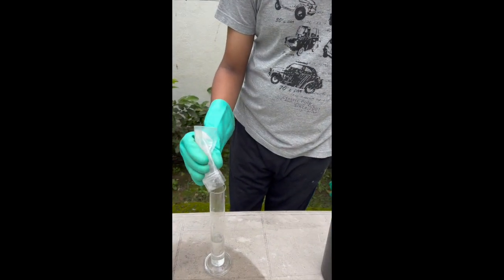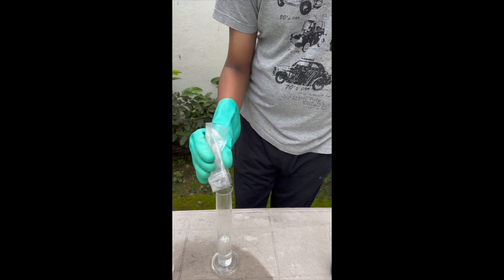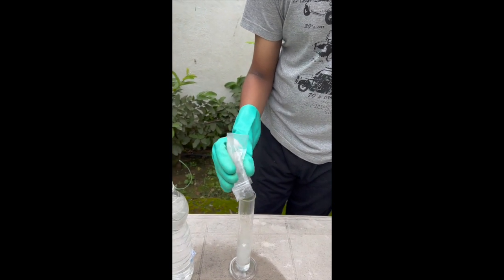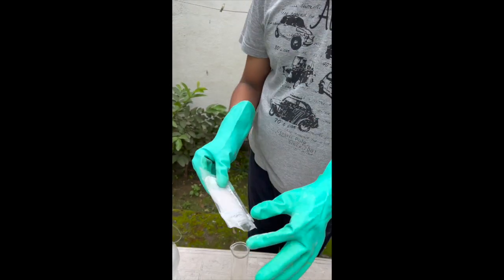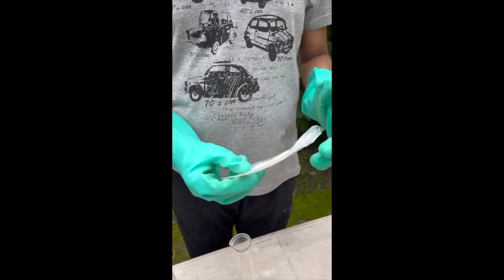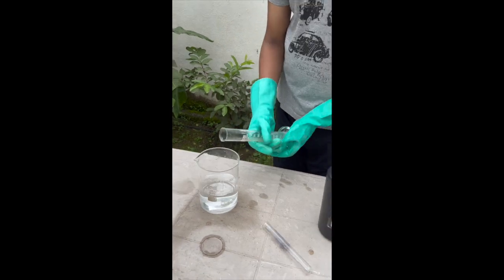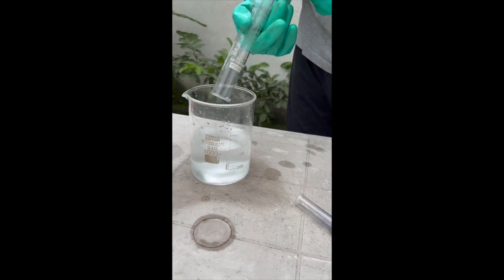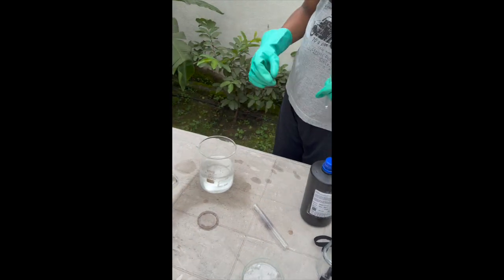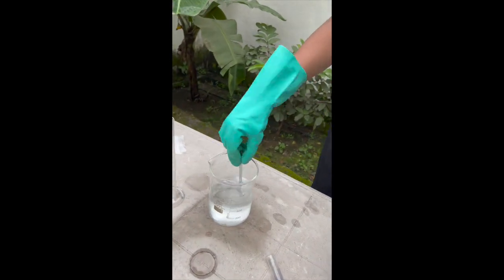Next, I took 0.2 grams of corn starch and added it to about 55 ml of distilled water. Later, I brought it to a boil. Now, I added it to the earlier solution that we had already prepared and now we should be done with the solution C.